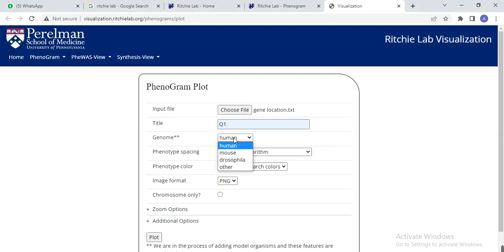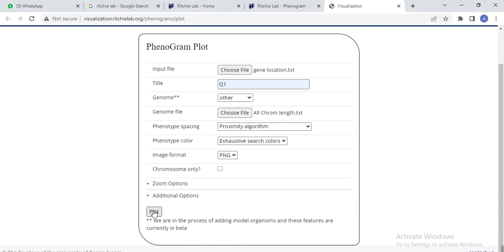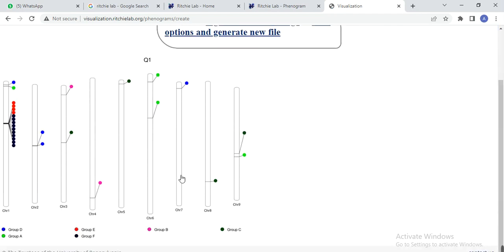Here we use the same method to choose the files, and after uploading these files, press plot. Here we get our results. We used the same input files and removed the error between these within the files, and then we got our results. Then you can modify the phenogram in any software like Paint, PowerPoint or Photoshop, make it according to your choice and then use it in your manuscript.